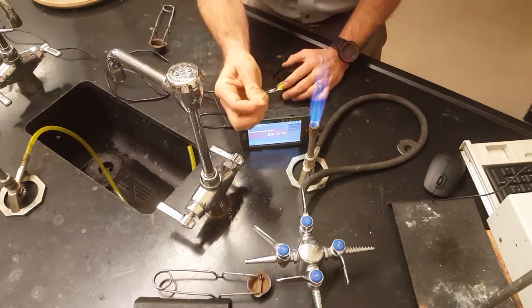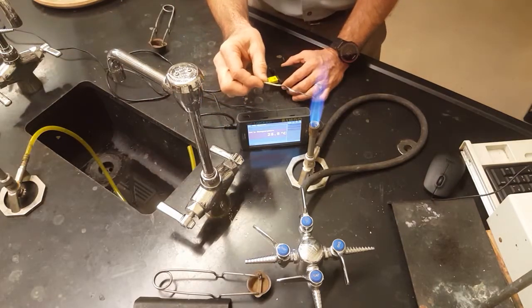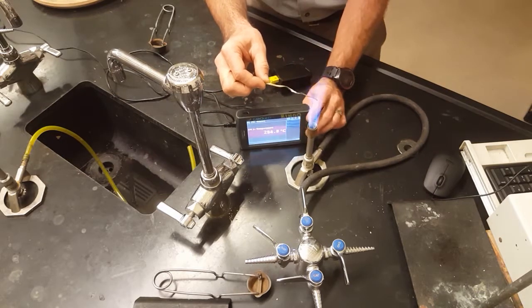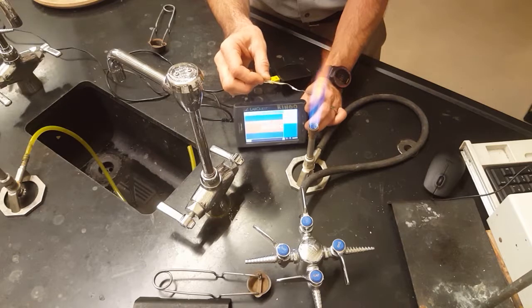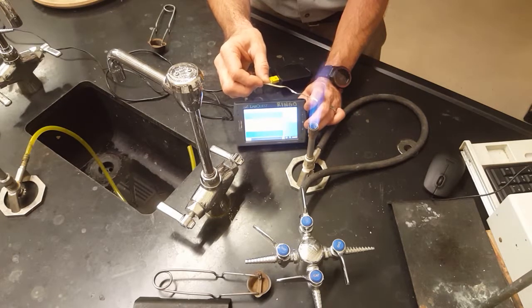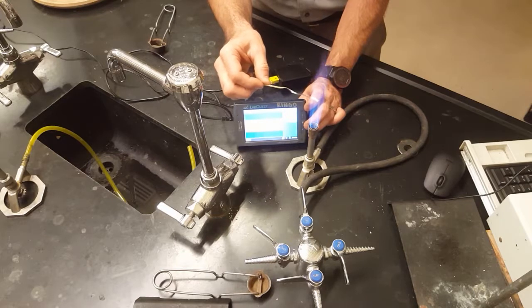This is your thermocouple tip, and wherever you place the tip in the flame you should get a pretty accurate readout on your lab quest for the temperature of the flame. So that's pretty simple. You're going to be recording different temperatures for different locations.